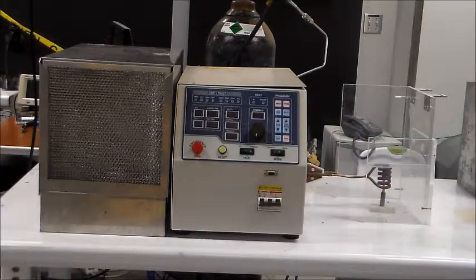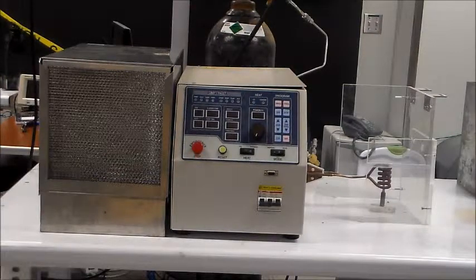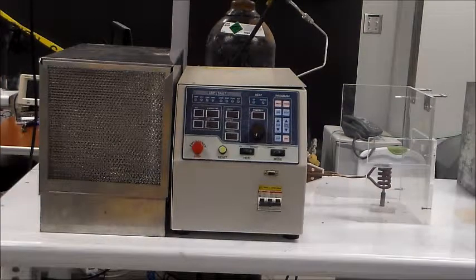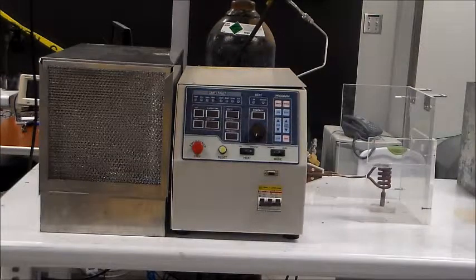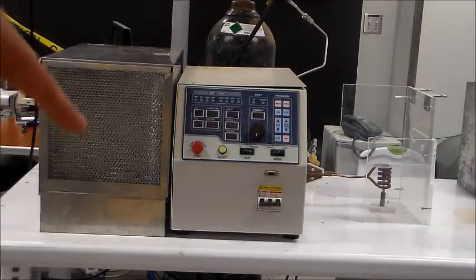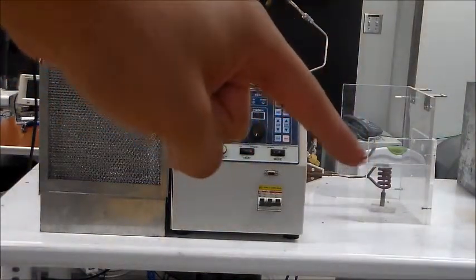In this video we're going to learn how to operate this RDO induction heater. This equipment is comprised of three main components which are the cooling unit, the heater unit, and the heating coil.